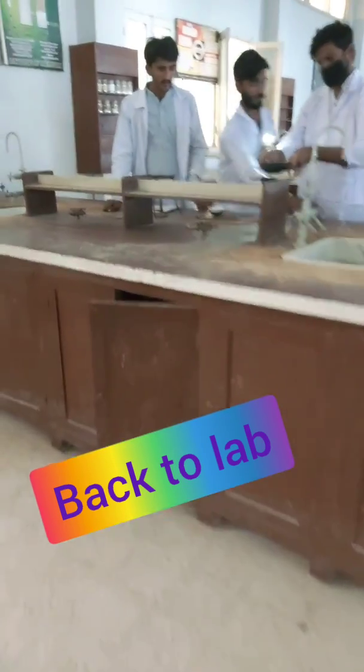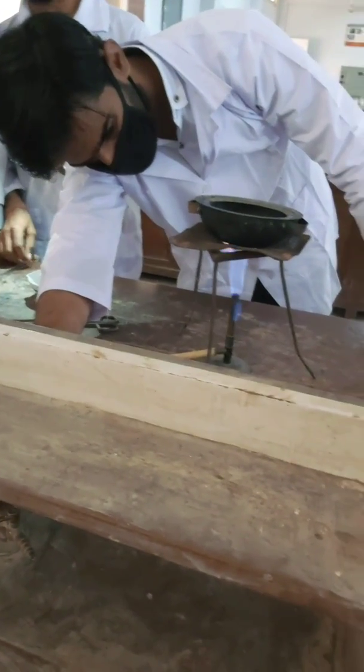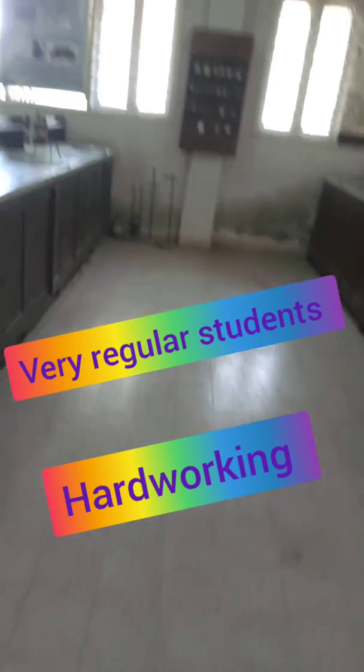Right now I'm standing outside my lab — this is the lab right here — and my students are working inside. It becomes difficult to breathe inside because it's full of chemicals. I'm concerned since they are carcinogenic and can damage us, so I'm standing outside for a while. Then I will go back inside to monitor them and see what they are up to as they prepare the Schiff base. The boys are now preparing the water bath because the reaction will proceed with the water bath.